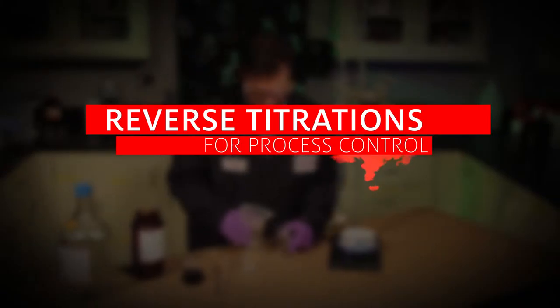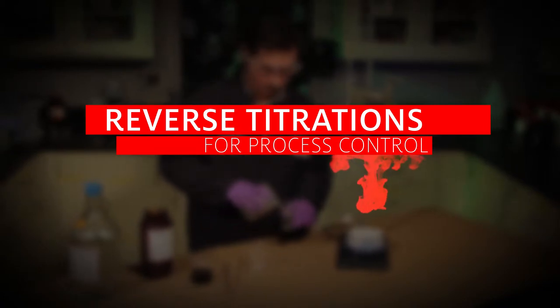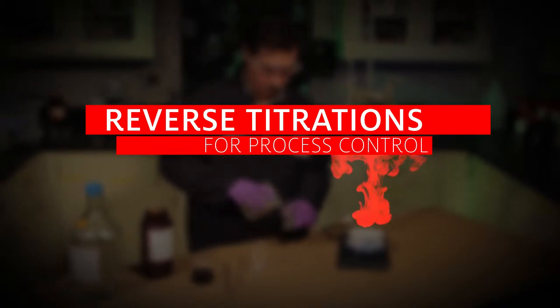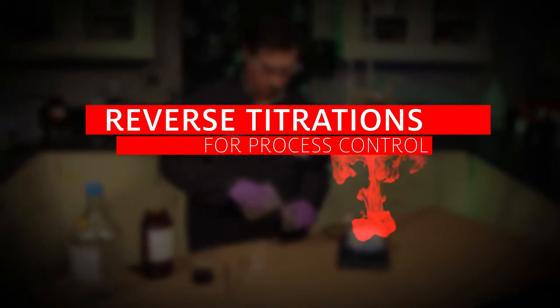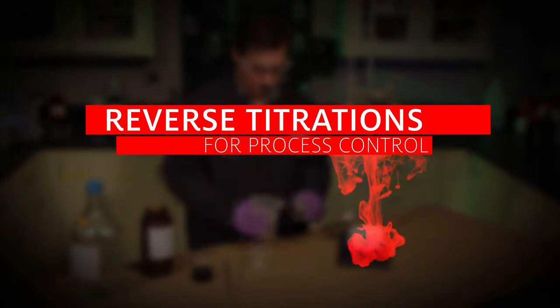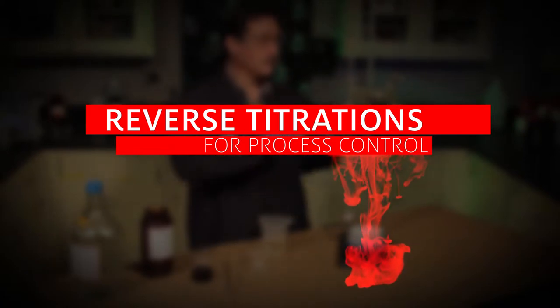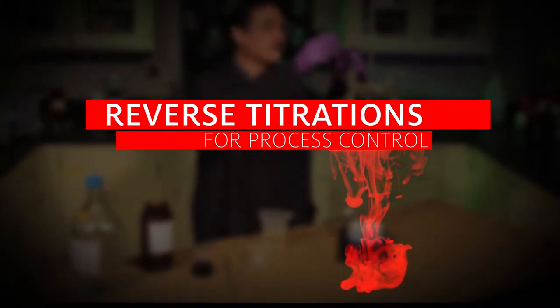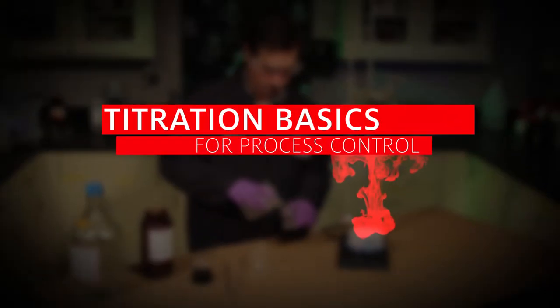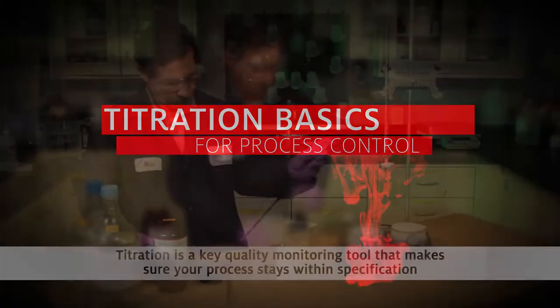This video introduces you to reverse titrations and how they are used to control some Henkel chemical baths. If you are unfamiliar with titrations, we suggest that you first view the Henkel video titled Titration Basics for Process Control.